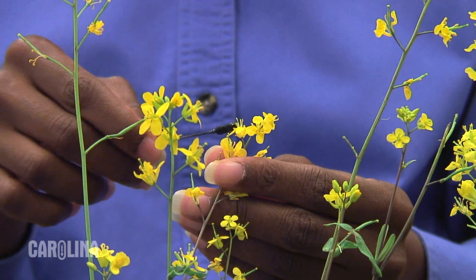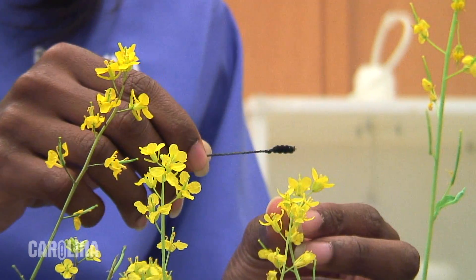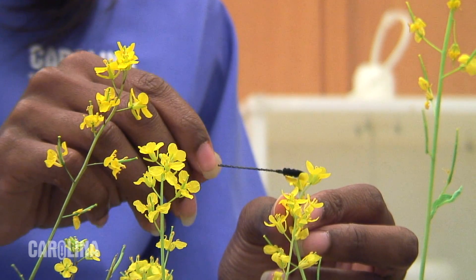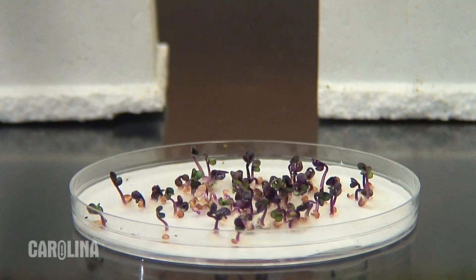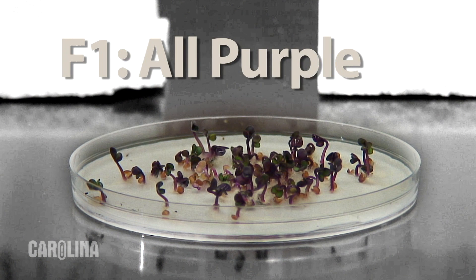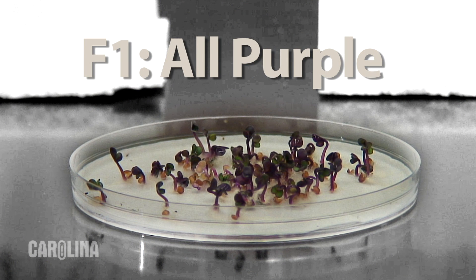Here we'll take pollen from a purple stem plant and use it to pollinate a non-purple stem plant. When we plant the seeds from this cross, all the seedlings, the F1, have purple stems. Purple is dominant to non-purple.